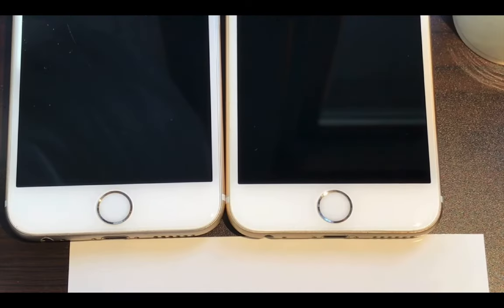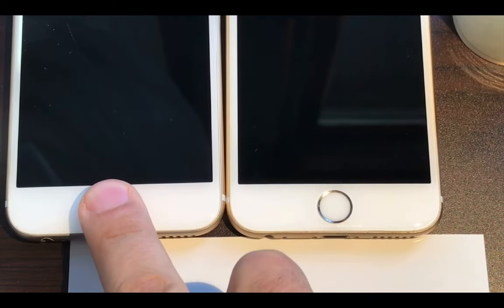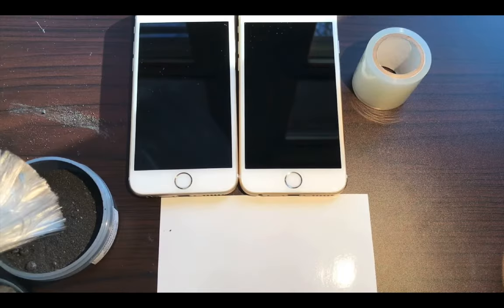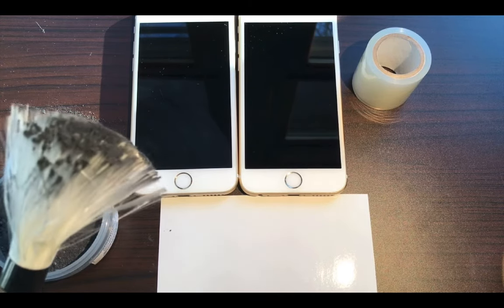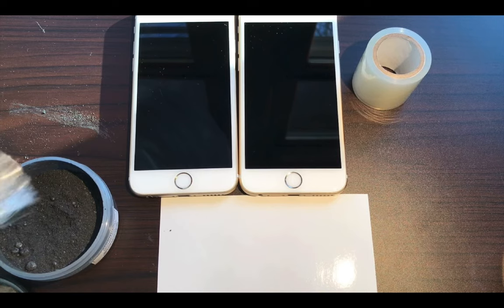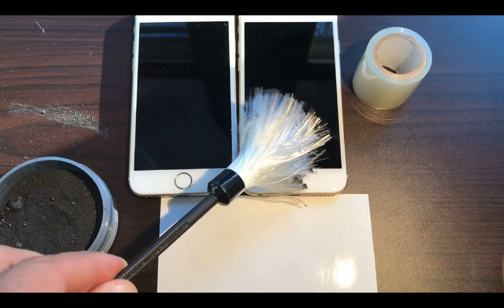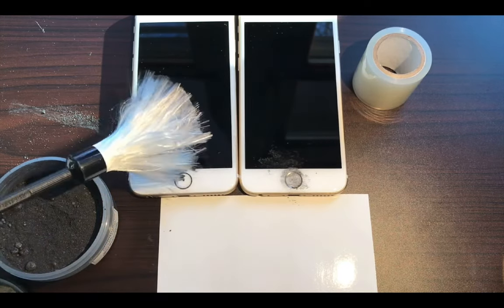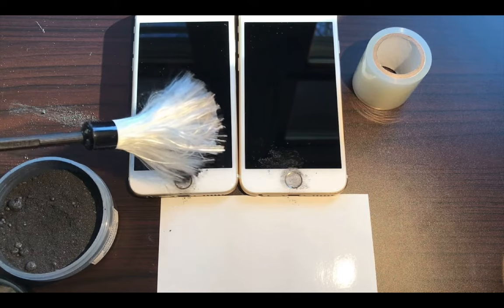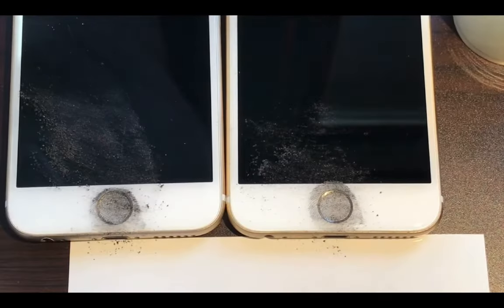Bichromatic just means two colors. It works on dark surfaces and light surfaces because it has black and silver powder in it. So all you need is just a little bit of dust, not a lot. This stuff is pretty nasty, and it can be quite messy. So just ever so slightly, you just kind of touch, and before you know it, you got yourself an image. You gotta be careful because you can smear this stuff.